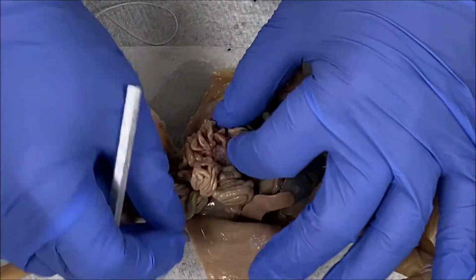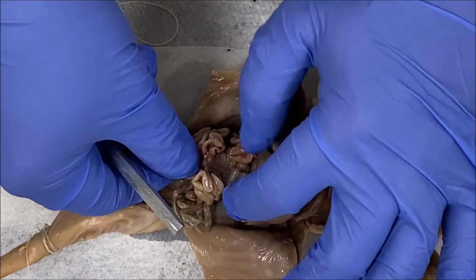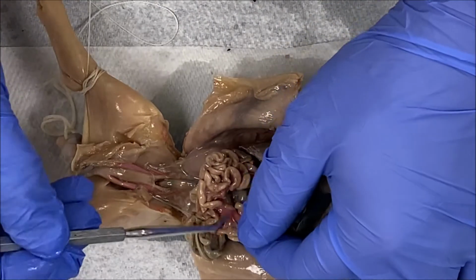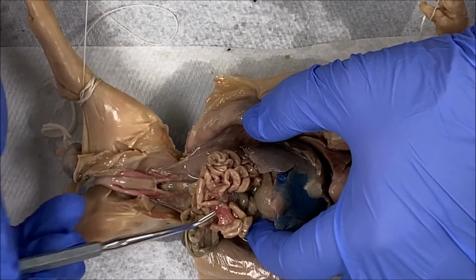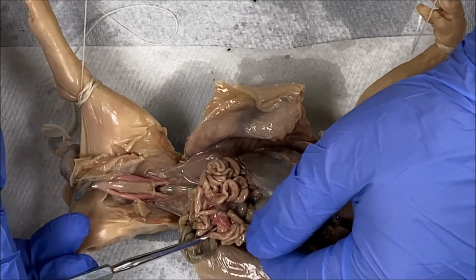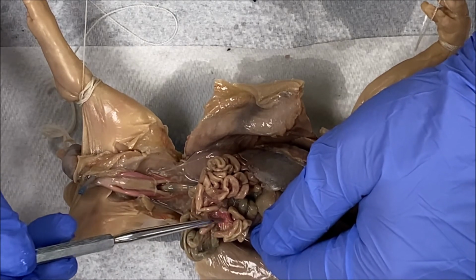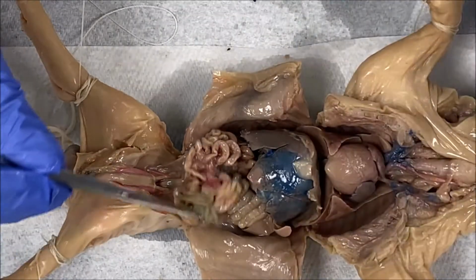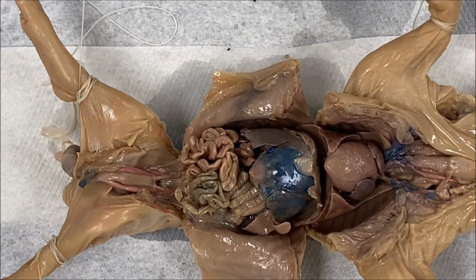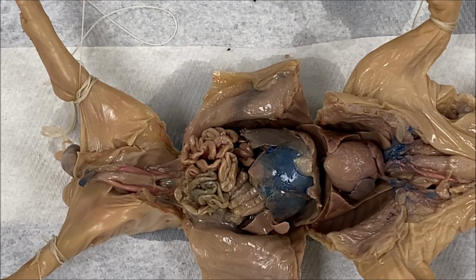Now, connecting the small intestines, you'll have a clear film, right, that connects the small intestines to one another, called the mesentery. So this right here, you can see it's very vascular, has a very good blood supply. But this right here is what we call the mesentery, and you can see the mesentery connects looping parts of the small intestine to one another. And that takes care of all of the organs of the digestive system that you'll be responsible for identifying for this dissection.